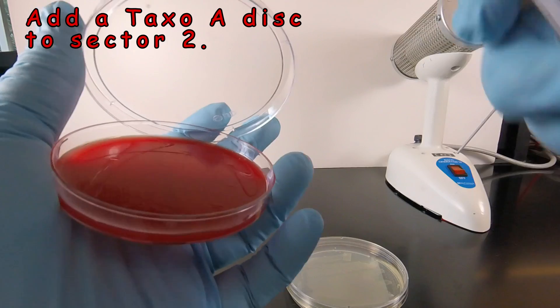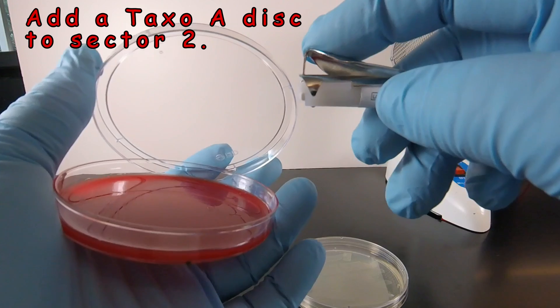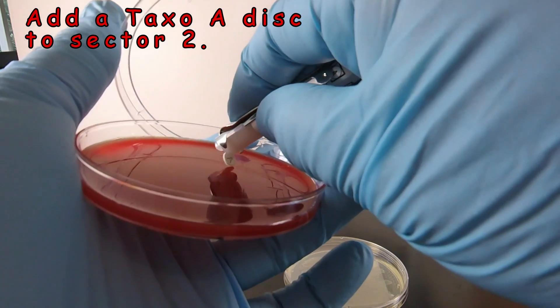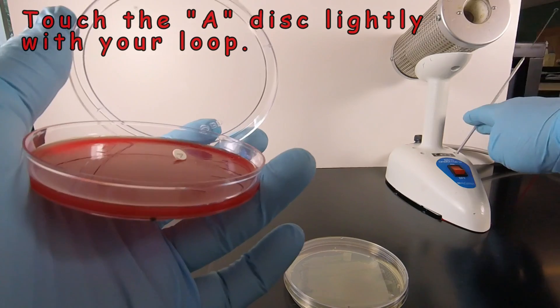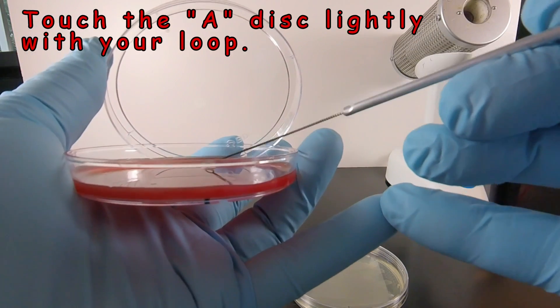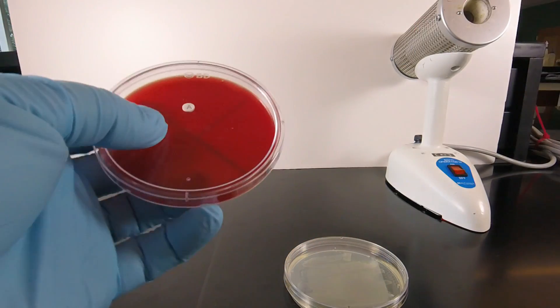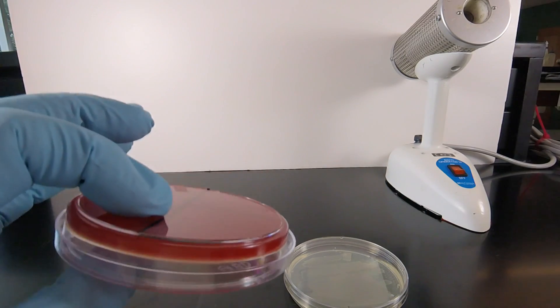We raise the lid. The dispenser is designed so that when we push down on the handle it will eject the disc. We hold that over where we want it in Sector 2 and gently push until the disc comes out. Then we take our inoculating loop and use that to touch the disc so it makes good contact with the agar. At that point, the blood agar plate with the A disc can be incubated upside down at 37 degrees.